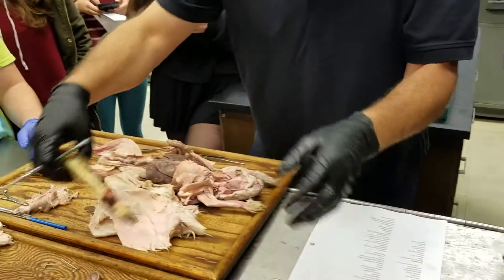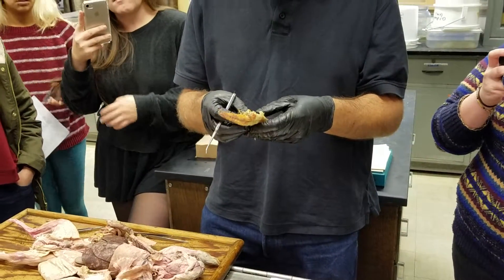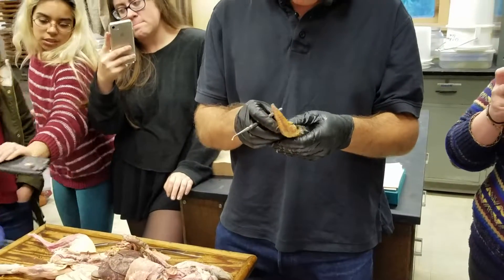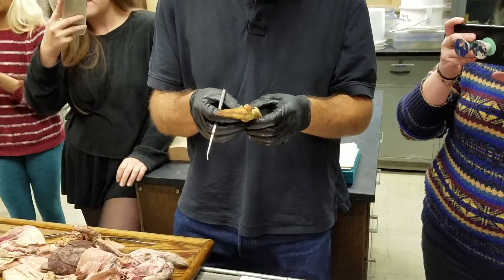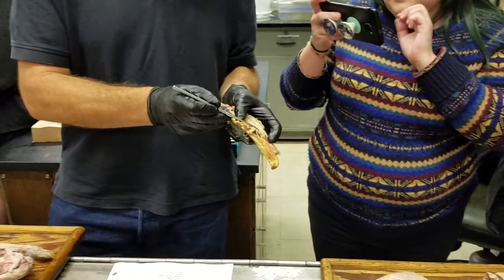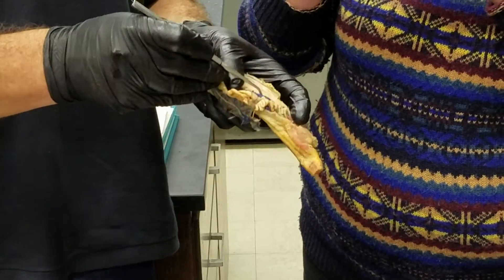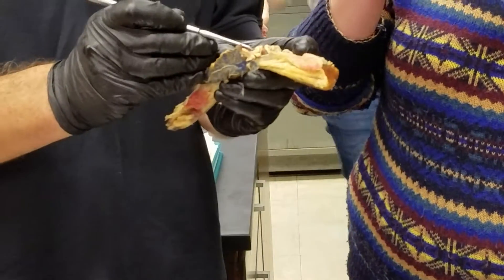This is a Necturus — it looks kind of sad at this point in the semester. This is a male, and we can see best on this side. Here is the testis, looking very blue — but they look pink on some specimens depending on which injection blew out.